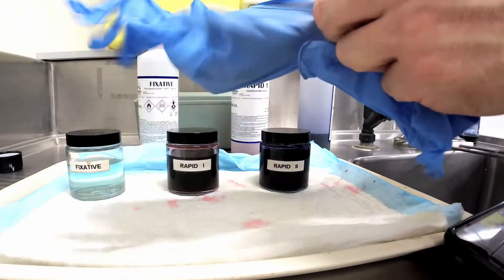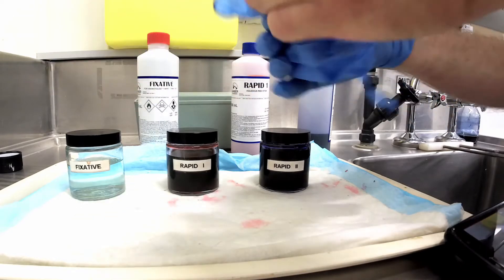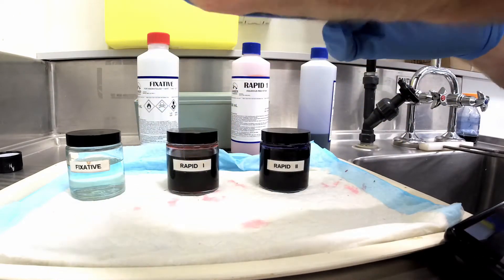Wear gloves while working with the stains and make sure that any preparations are completely dry before staining.